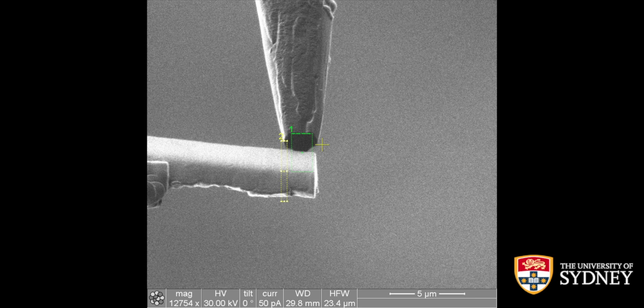So this is once again a very critical step, because you have your lift-out bar, which is attached to a chamber, in contact with your support structure, which is in touch with the stage. So if you can't lock the stage, if you accidentally click somewhere and things start moving, things will also start breaking.